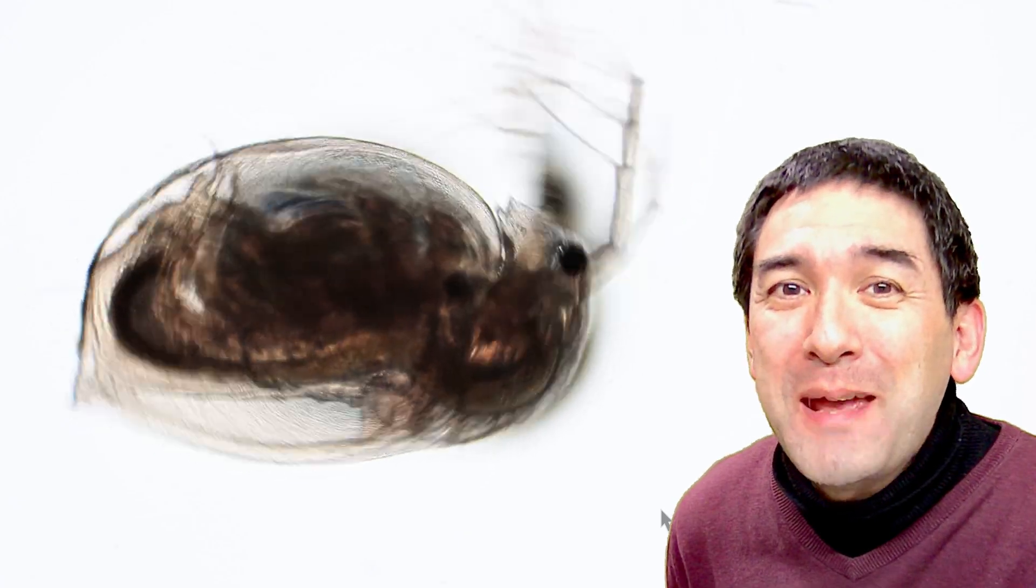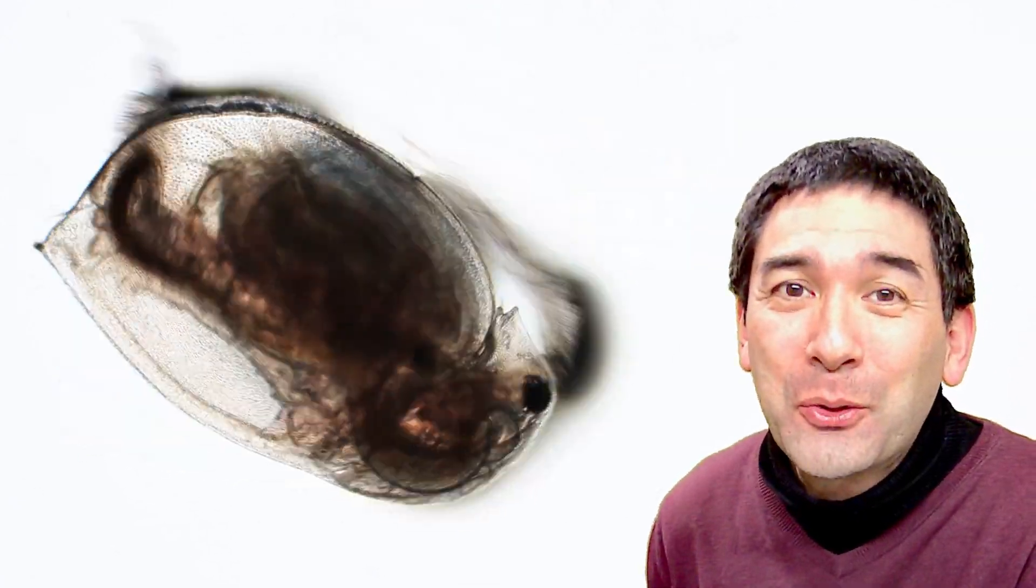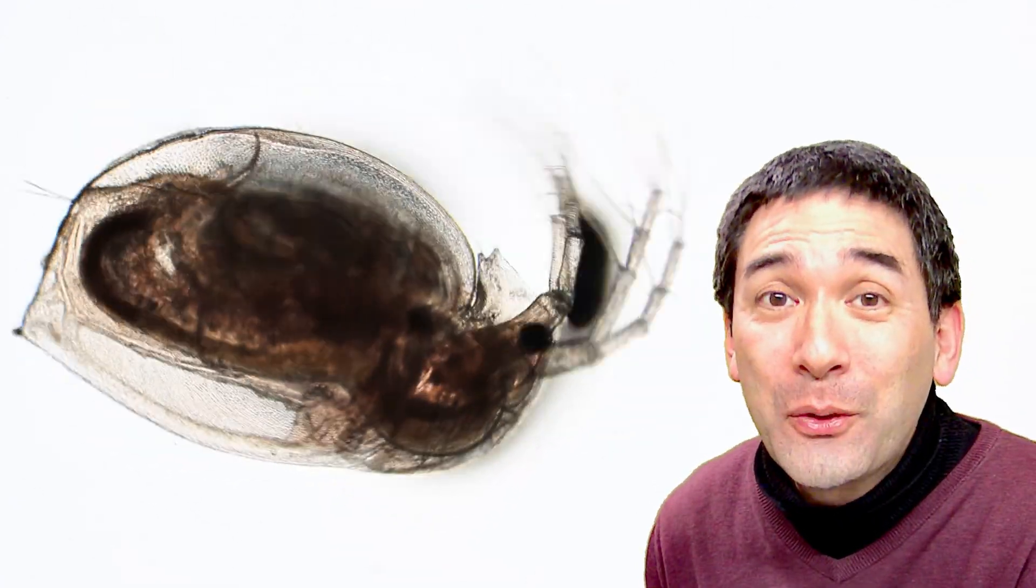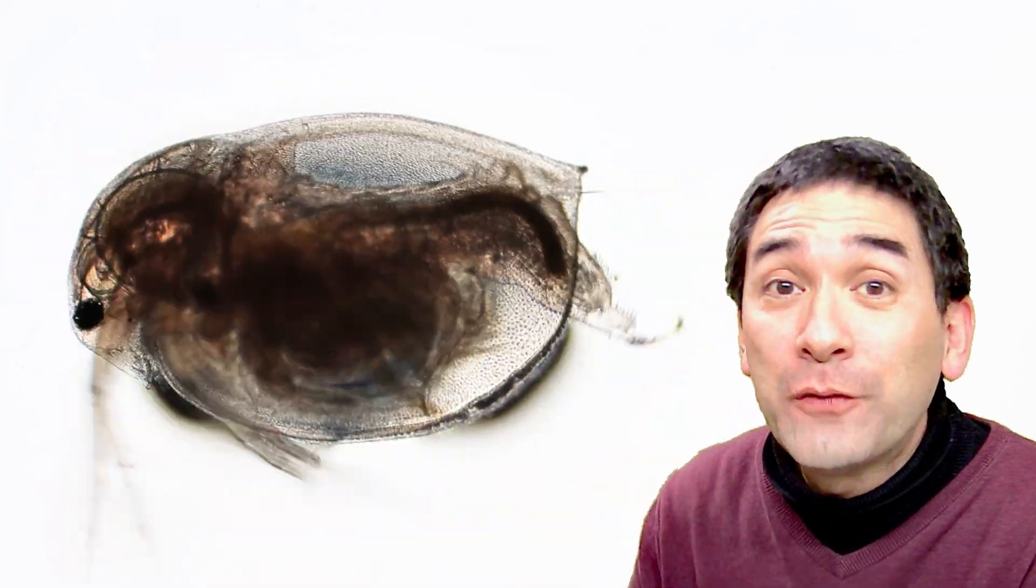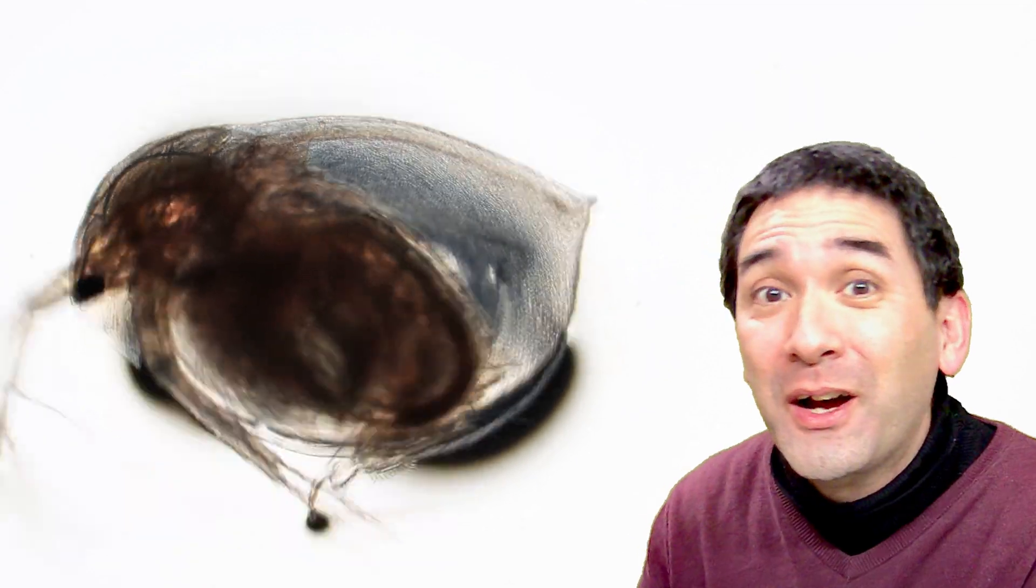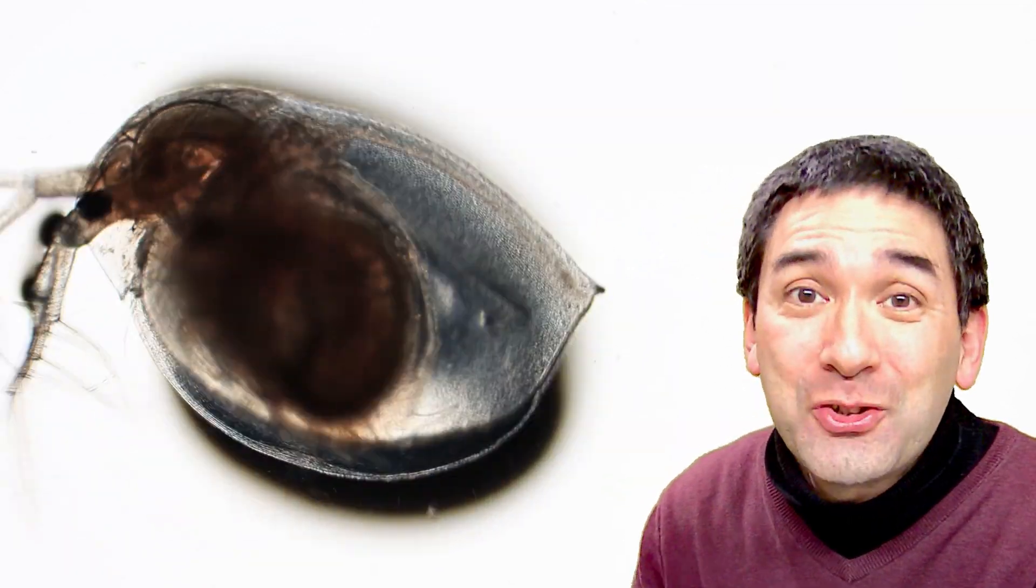And of course I wouldn't be making this video if there were no effect. Of course there is going to be a remarkable change, and specifically I'd like to show you the effect of alcohol on the heartbeat of this little water crustacean.